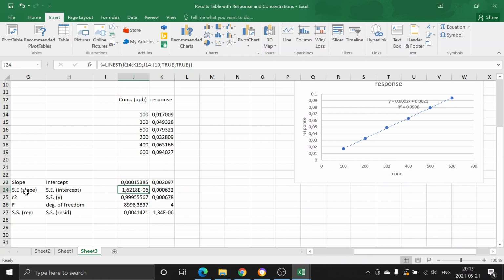This is the standard error in slope, this is the standard error in intercept, this is the R-square value, this is the standard error in the predicted y values, this is the F value, degrees of freedom, sum of squares of the regression, and sum of squares of the residual. These are the numbers that are created. Of course, you need these two only, slope and intercept.